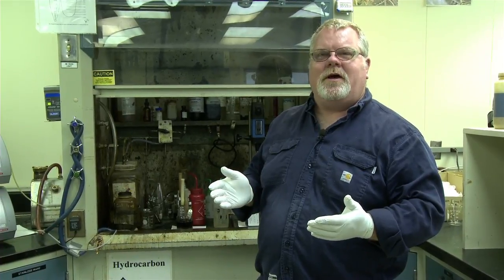So another thing that we do a lot of in this area is freeze protects. When a well's shut in, obviously you don't want the produced water in the line to freeze up. Have had problems with that in the past. So when they freeze protect a well, they'll collect a sample, I believe, on the opposite end of where they're pumping to, and then they'll collect that fluid, dead crude, methanol, typically a mix.